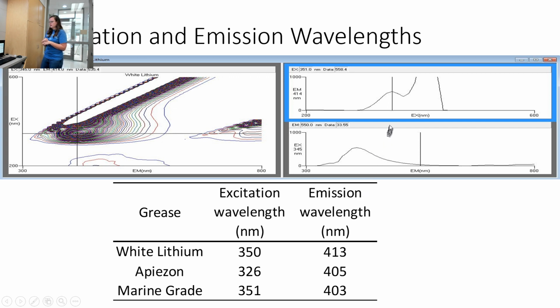Normally, or baseline, it's about 700 volts. I had to lower it to 400 volts because that white area in the middle is called flat topping. That's when your signal is too fluorescent. And so these were the excitation and the emission wavelengths that I got for the 3 solid greases. The Apiezon was the one that was most distinct because it was at 326 compared to 350.